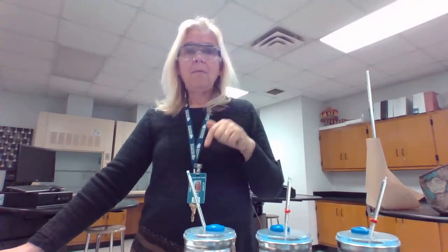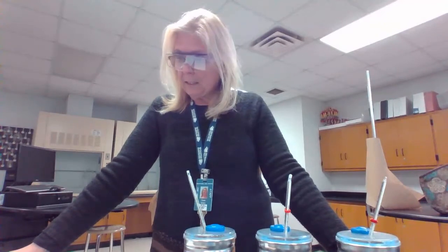The temperatures are degrees Celsius. The masses of the water was in grams because we converted it from milliliters. That means that you are going to be calculating using water's specific heat capacity in joules per gram degrees Celsius. So make sure you use the right number for that.